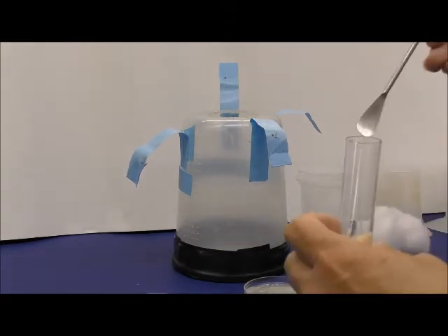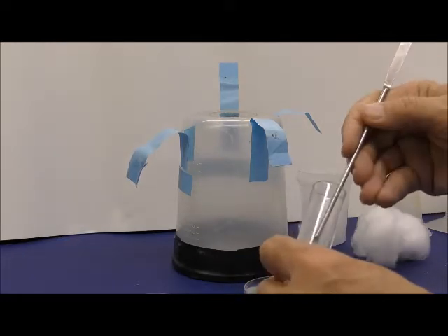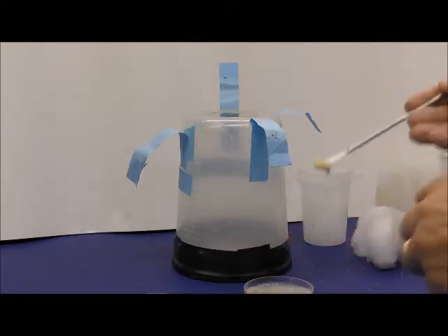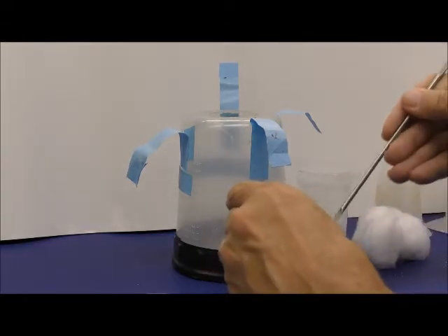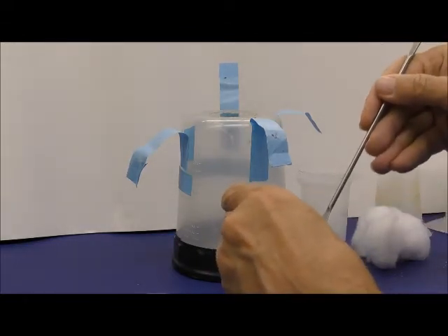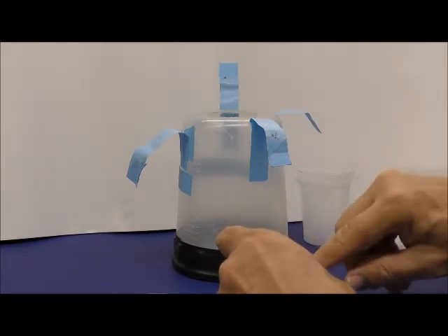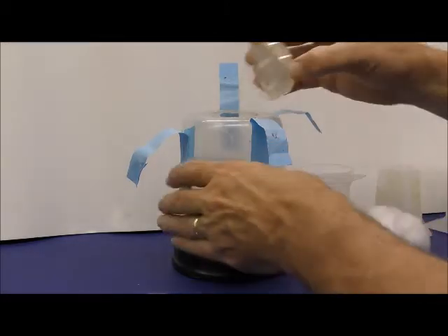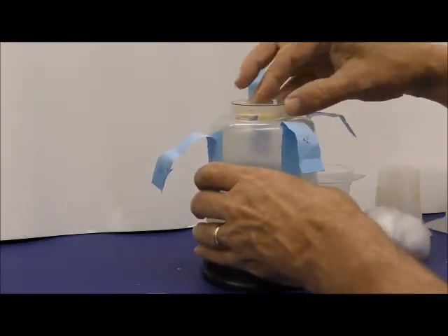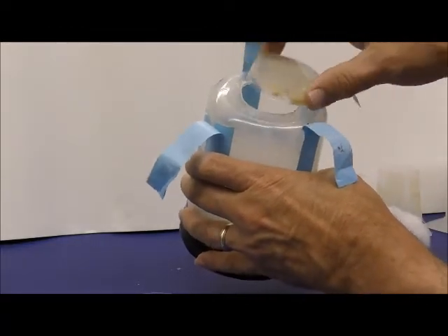And if you want to keep your adult flies alive, you take a little bit of that cornmeal food that you've made up, the standard food, and put that in there, and pack it in so it won't fall out. Pack it down hard, and it won't fall out. And now you can put that on top of this, and you can see it's going to fit really nicely because I didn't cut too big of a hole.